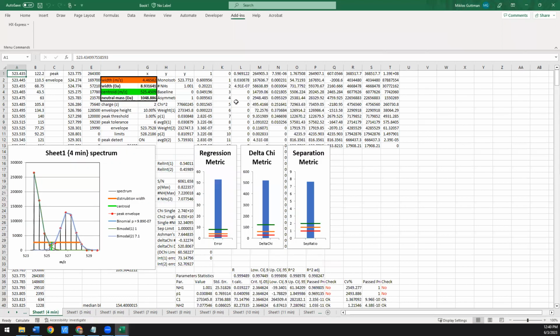Okay, so this is what it looks like when you have a really clearly well-resolved bimodal. So if you look at all of these, the bar graph height is through the roof. You're way above that 99% confidence interval. And that's what you expect. I mean, by eye, you can readily tell these are super well resolved. You can probably even fit these by hand if you needed to.